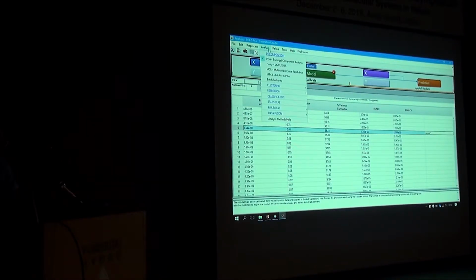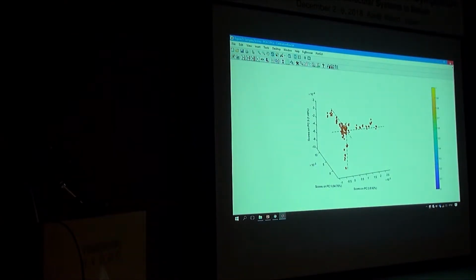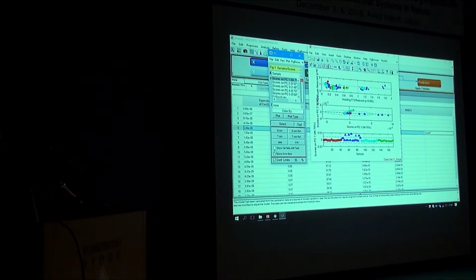But you can do other types of analysis. For example, you can do other classification methods like PLSDA or SVM. I got the best result from KNN, and I will present that tomorrow. And for regression, local regression was the best for me. So let's see the PCA on the test set. Let's close. So here, what you see is just the test set.